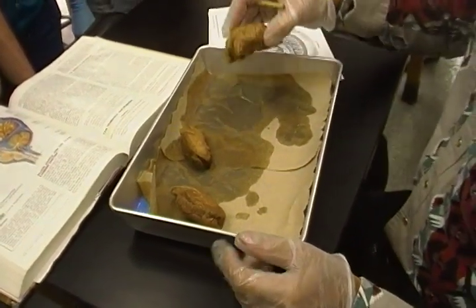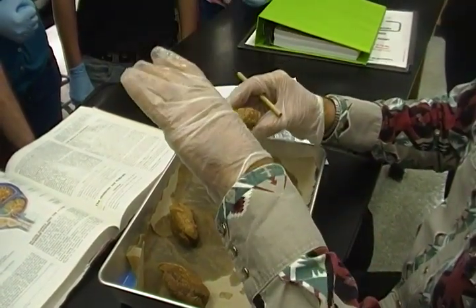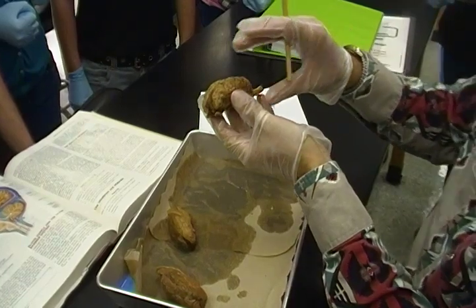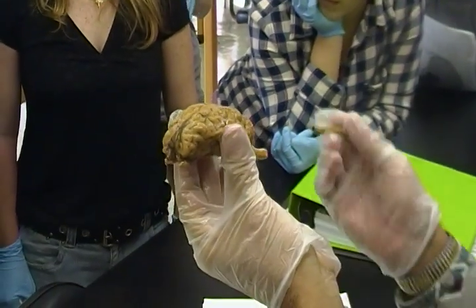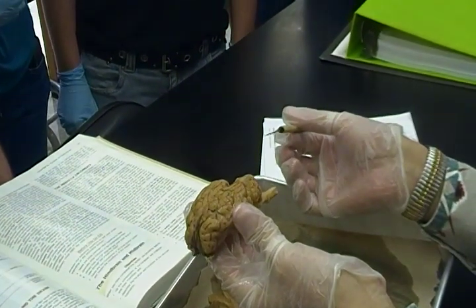Remember that inside of a little sheepy, their head is more oblong, you might say. It's not round or rounder like ours is. So everything's going to be stretched out a little bit longer. So there's our brain. What portion of the brain is this going to be? Cerebellum. That's the cerebellum. All right.